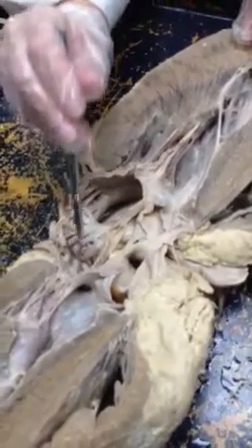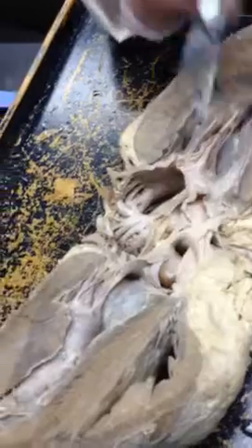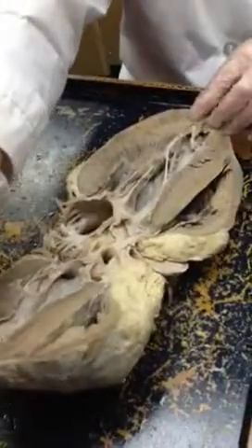We'll pin it from this side for the tricuspid, and then from either side for the bicuspid. The pulmonary valve we can't see, so this is the only bicuspid and this is the only tricuspid — well, there's both sides because of how it's been cut. For the test, they'll use whatever is picked out of the buckets, so this might be one of them.